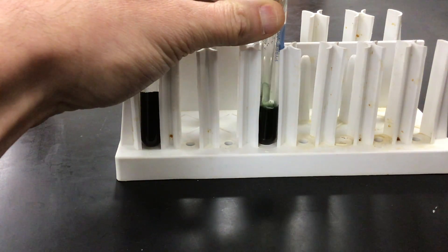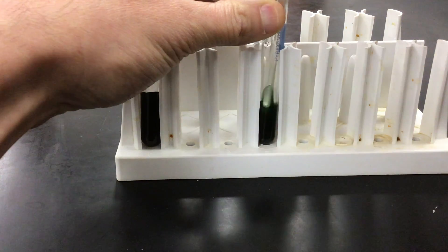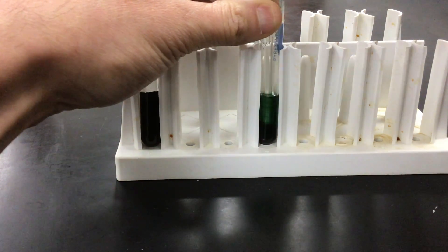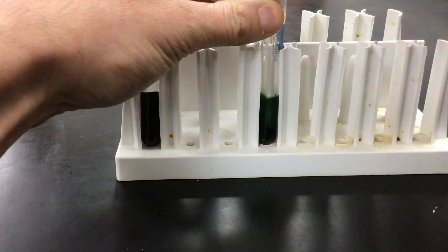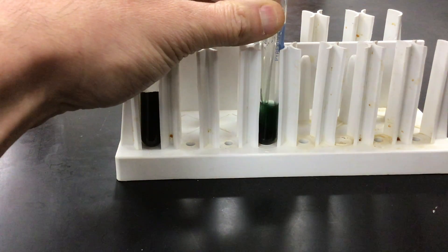It takes up to a minute or so as more and more of the copper solid dissolves.